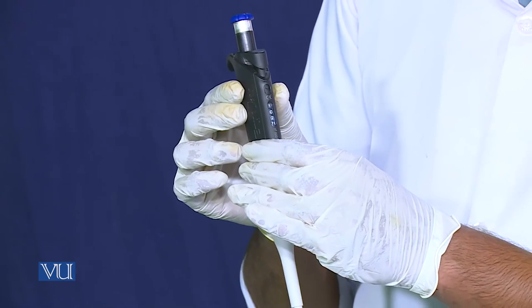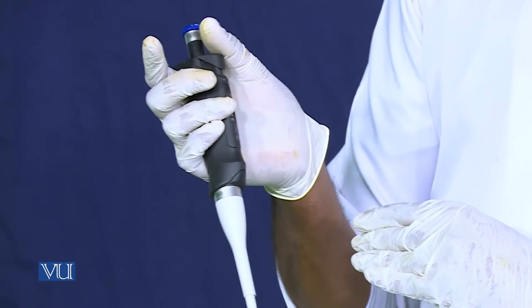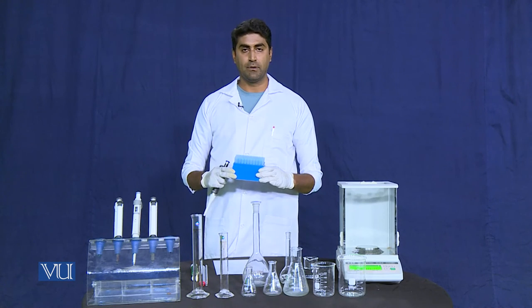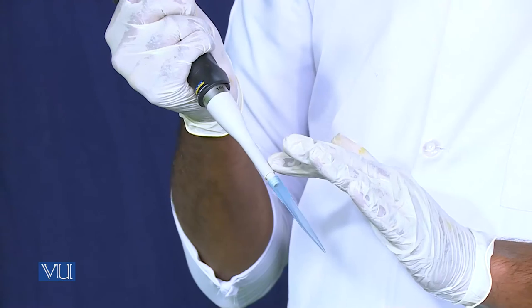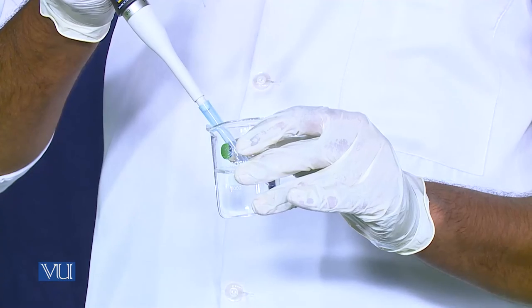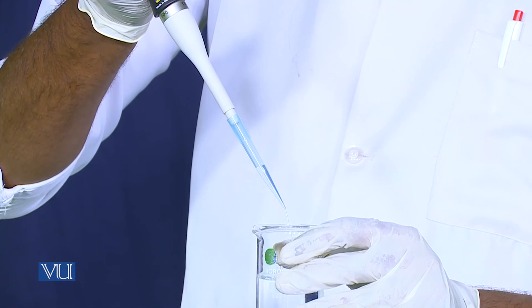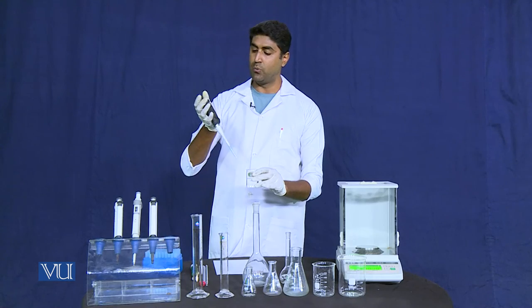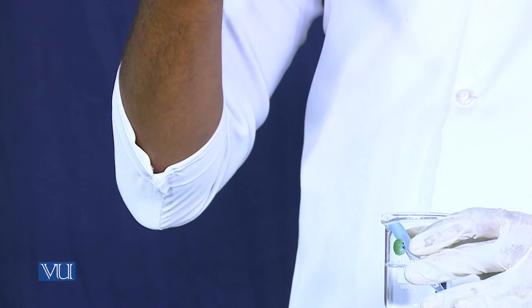The next part of the micropipette is the tip ejector. The tip ejector can remove the tip. This is the micropipette tip, which we put on the tip cone of the micropipette. With the plunger we can aspirate liquid into the micropipette, and by pushing it down we can dispense the liquid out. With the tip ejector, using my thumb, I can remove the micropipette tip very easily.